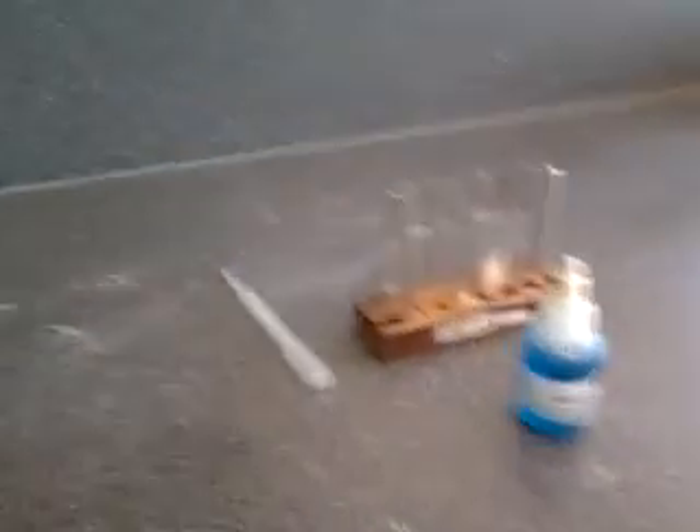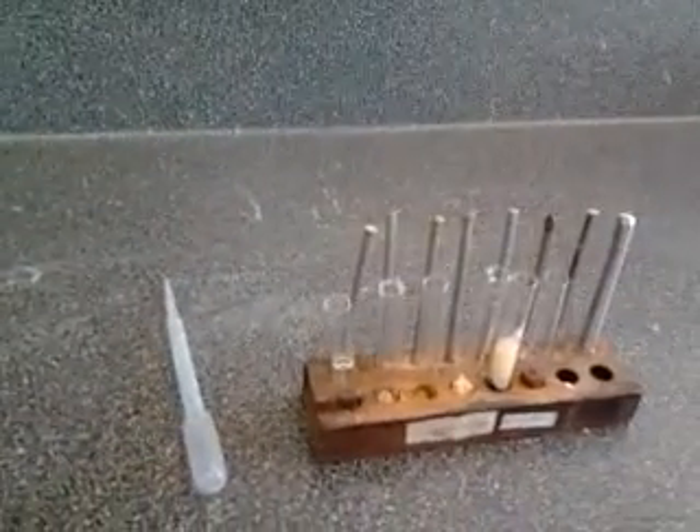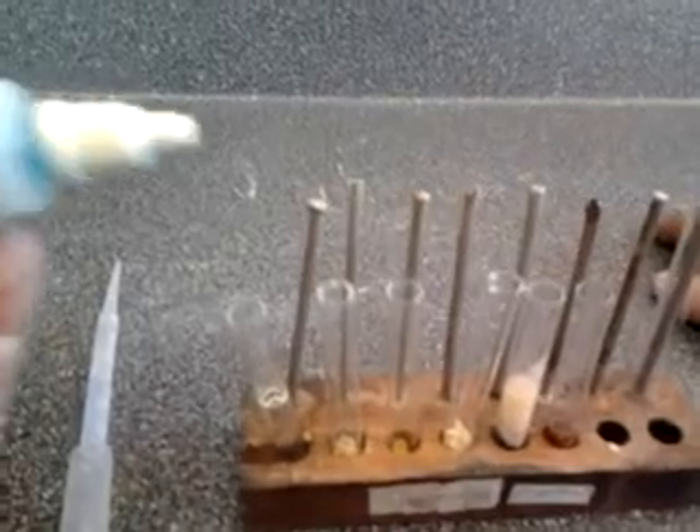They're using glucose, plain chips, cheese balls, unsalted peanuts, mashed banana, and mashed sultanas. We'll add two drops to each test tube.